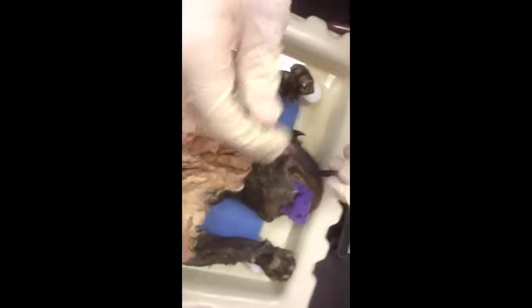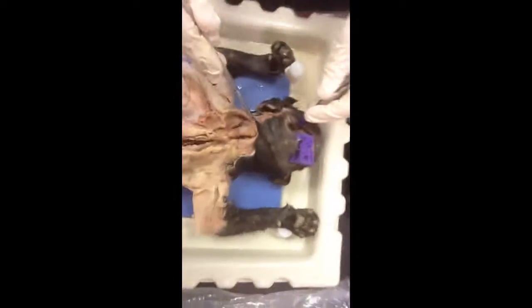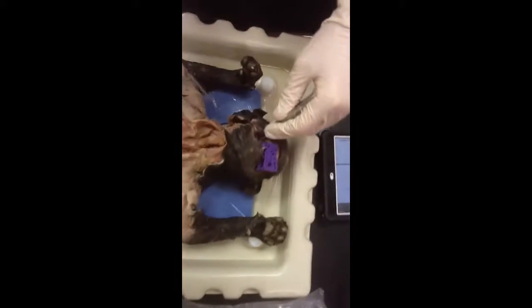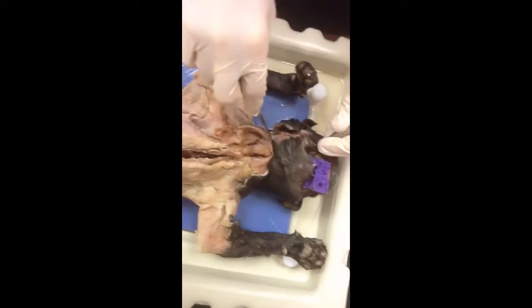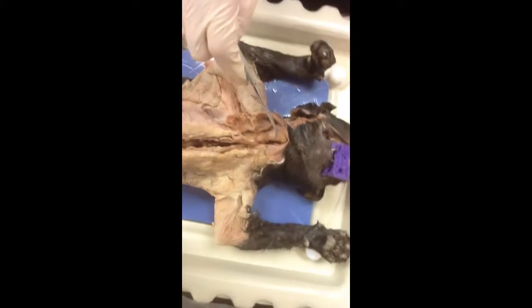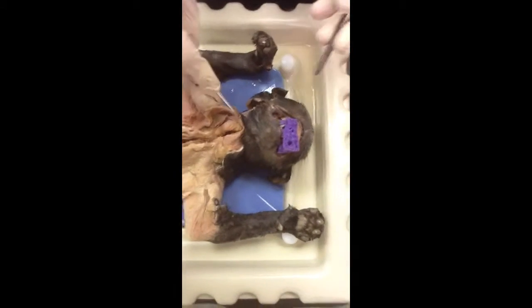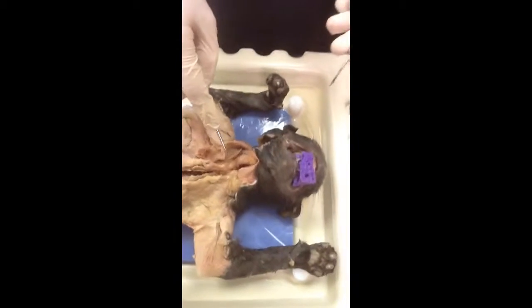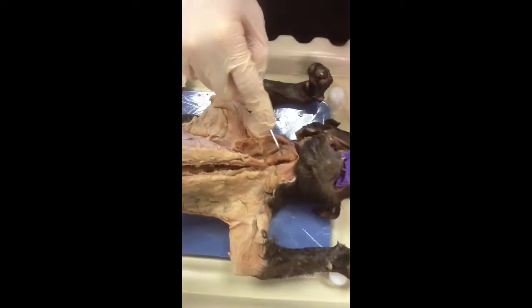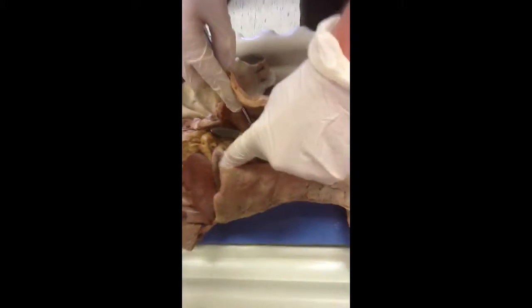Salivary glands are inside the mouth, under the tongue and in the back. And the parotid gland is at the top of the pharynx area. Submandibular is just another salivary gland right here under the tongue. Pharynx is at the top, above the larynx and the esophagus and trachea. The esophagus goes down here all the way to the stomach, which is under here.